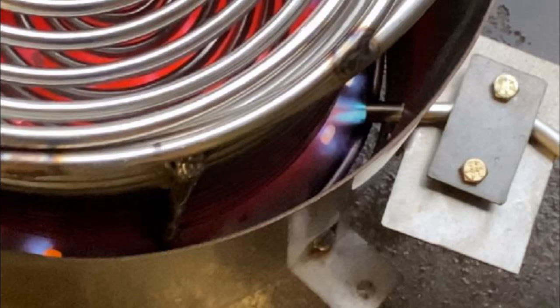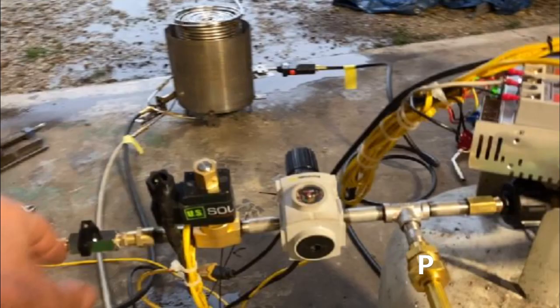You want to have that pilot light turned down as low as you can get it. Unfortunately, this one won't go as low as I would like — I just didn't have the time to get one. I had assumed the store would have one available, so I did not order one online and I was wrong, but it works nonetheless. The place you hook that up is right here on this valve body assembly where I have marked the letter P in the lower right-hand corner — that is where that will connect.